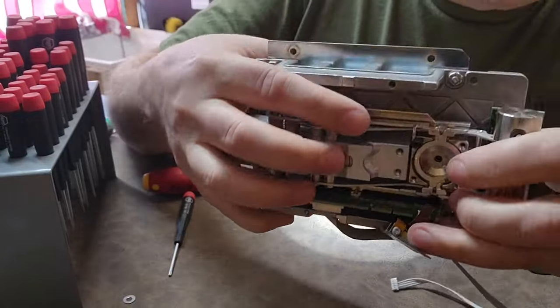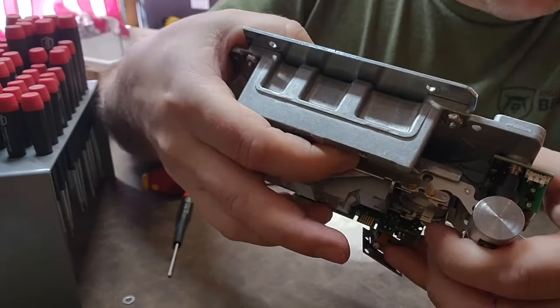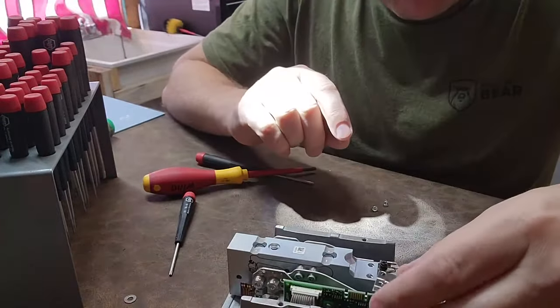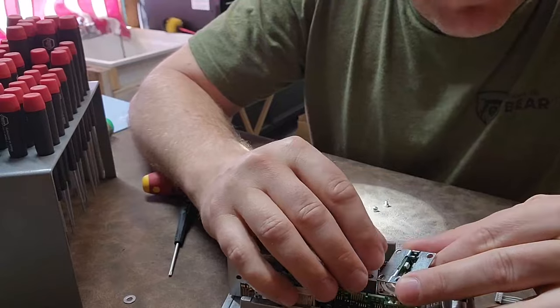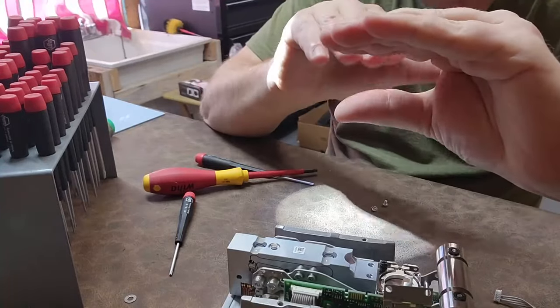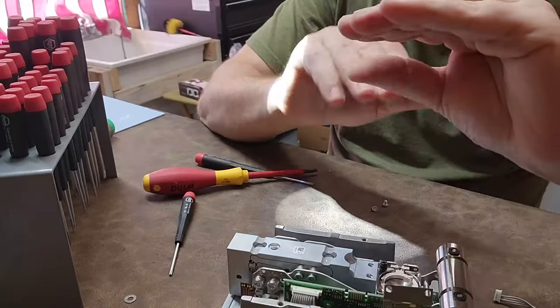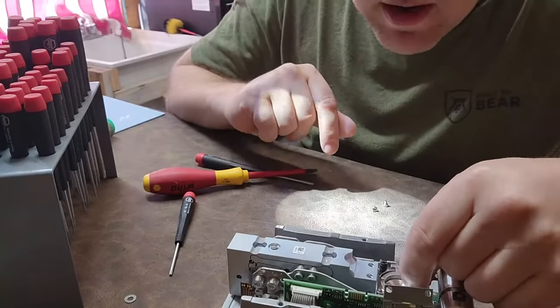If I invert it you'll see the little slit in the bar — see that guy right there? When I overload it, that little bar moves — just a couple of millimeters — in and out of the light path. That makes it extremely sensitive and very repeatable. There's a photodiode and probably an infrared transmitter on this side. When the bar is in normal position it can read the light, but when it moves just a little bit it blocks the light path, and the receiving diode sends an error code.